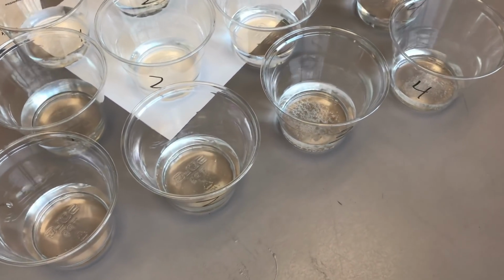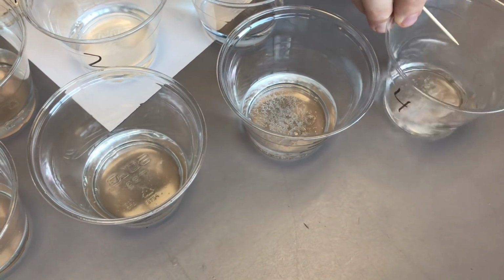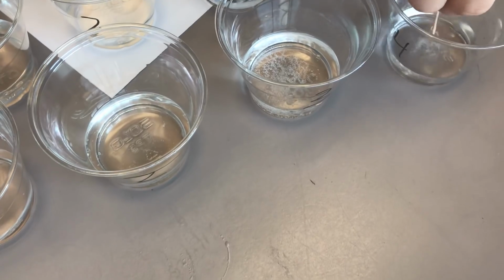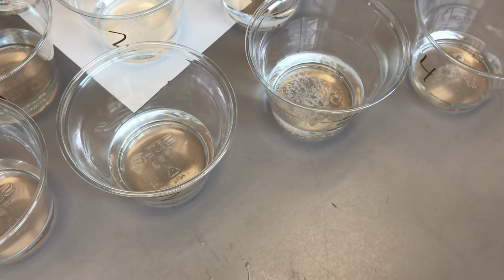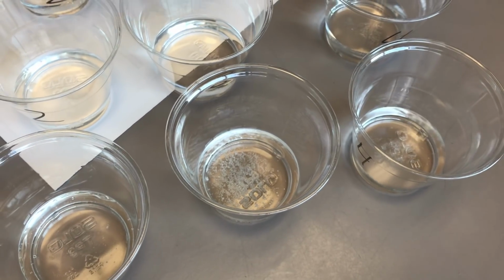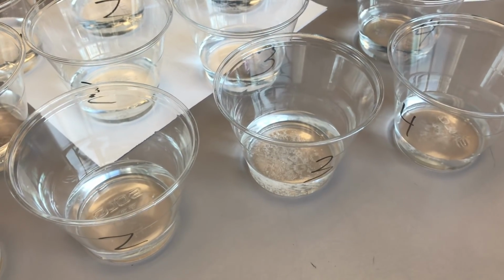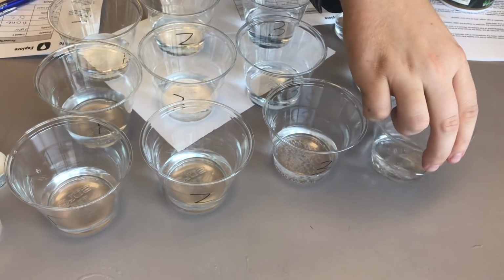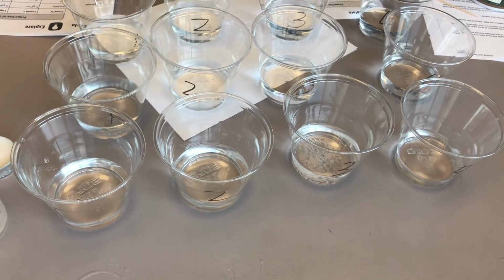We'll grab a clean toothpick to mix it up, and then I'll kind of spin it around to give it some chance to dissolve. And it looks like it's starting to dissolve. All of it's still taking a little bit of time, but that is allowed. We can still see here 3 though. There's still a lot that is not dissolved. So 3 did not dissolve, 1 did, 2 did with sugar, and 4, it looks like it's almost done dissolving. So sugar dissolved in liquids 1, 2, and 4.